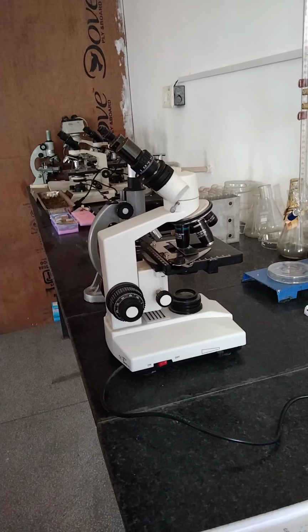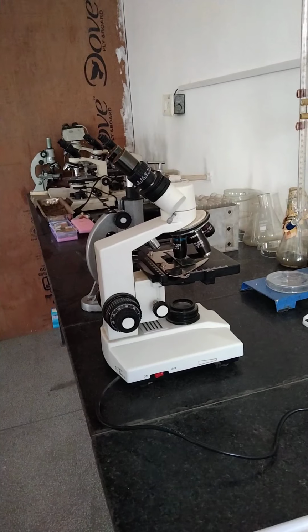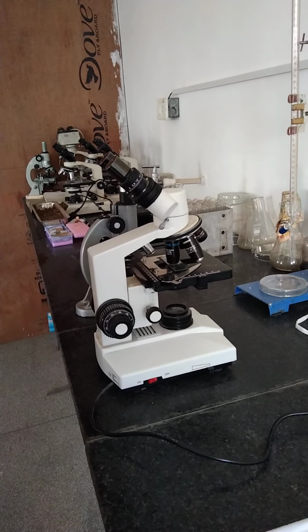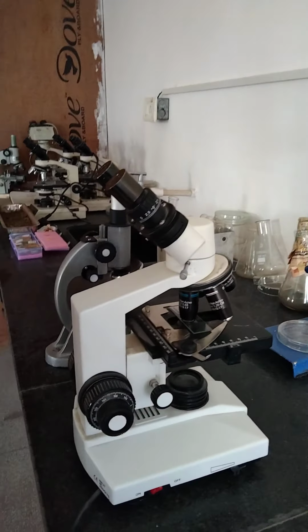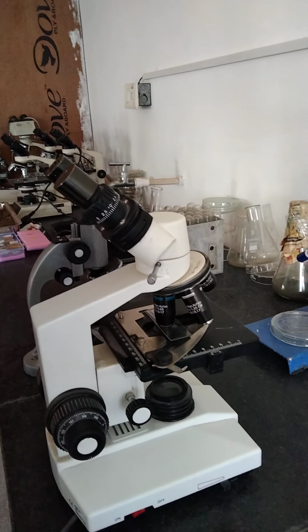Students, today we will start with the introduction to laboratory equipment. So we will start with the microscope first. In this video we will discuss the components and handling of a microscope, right? So the aim of this experiment is to study the components of a light microscope and its parts.